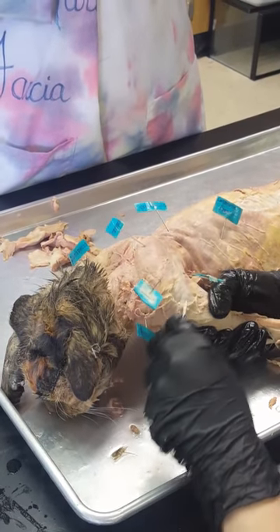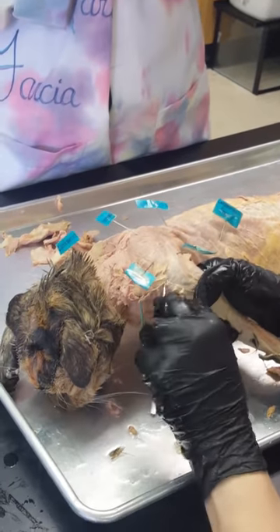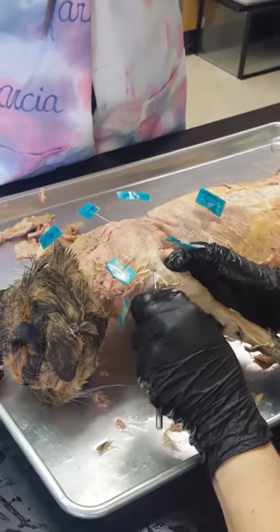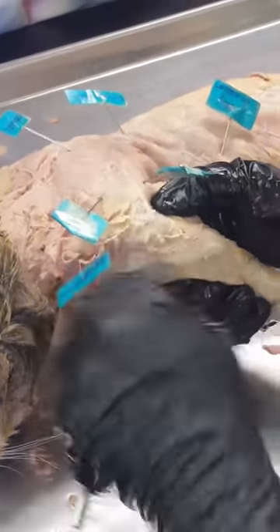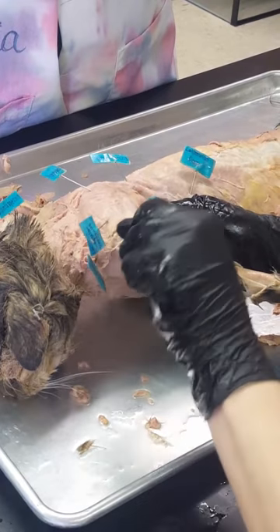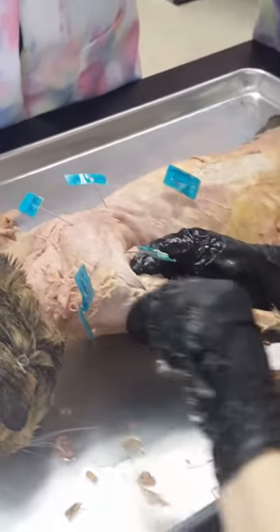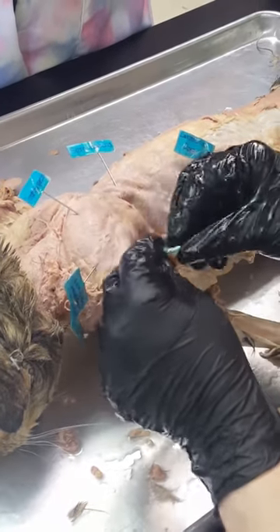Here's the only time you're going to want to pinch in — you want to get underneath this tendon and pull it out of the way. And there's your delt. See that pretty muscle I just uncovered? That's your acromiodelt.